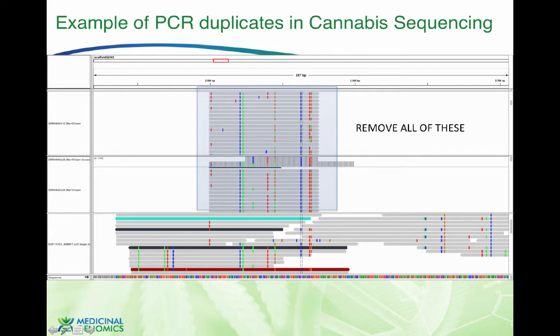So this is your primer sequence here. And the Illumina primer that's on the array is right here. It's tailed, you can't see it. It sits here, sequences across your primer sequence. This is all man designed, so this isn't real sequencing variation that's going on here. A lot of people get confused by that when they design primers. They don't realize that their primer sequence cannot be genotyped because it's not real, it's what you designed.